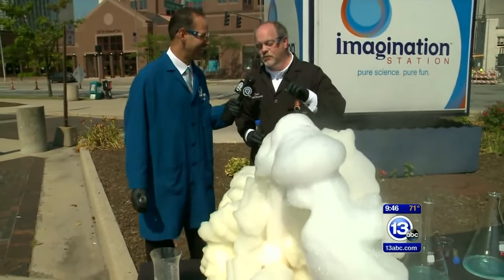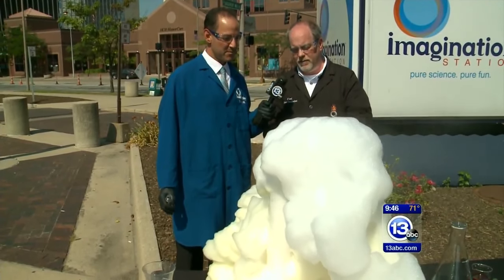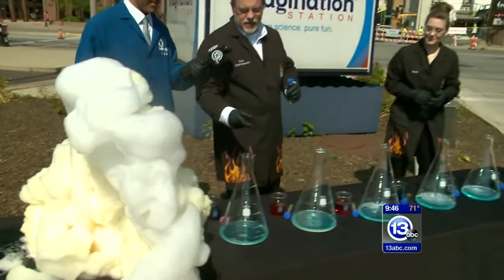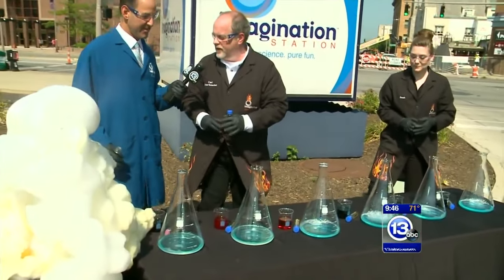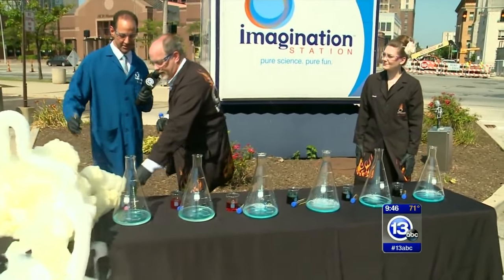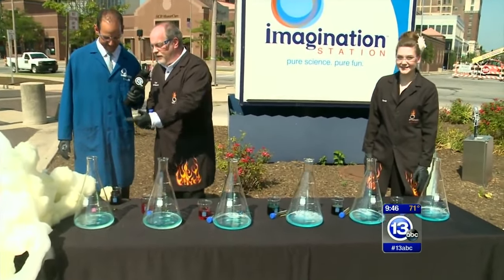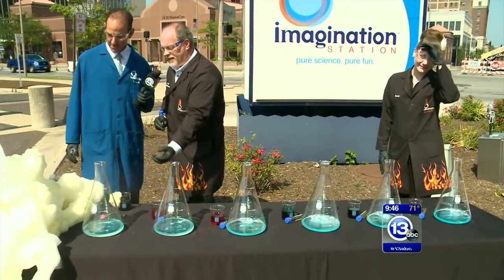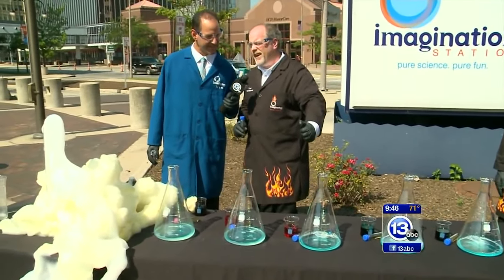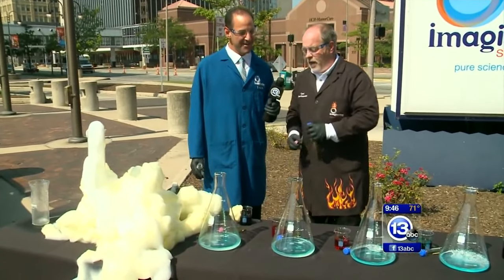But now I want to take this one step further. I want to change another variable here. Instead of doing this in a big graduated cylinder, I have set up down here six flasks which taper near the top. What I'm hoping here is that as we generate this gas, it is going to generate some pressure, and inside each of these flasks we should get a jet of foam shooting out.